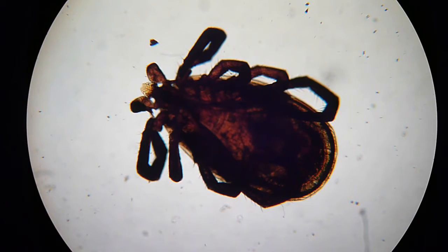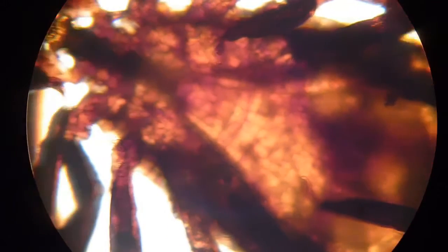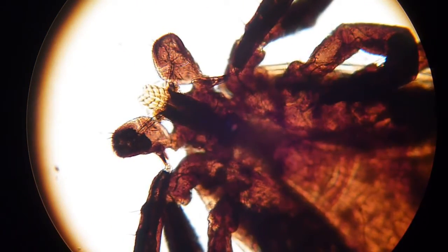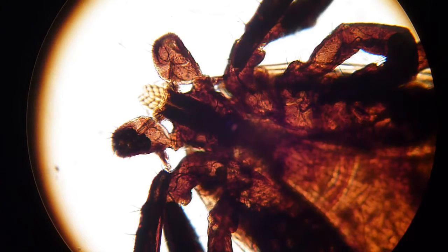I have to refocus. Let's center it first. It's the head part over here. I might have to close the condenser a little bit if this is possible. I'll close the Köhler diaphragm, the field diaphragm that is.